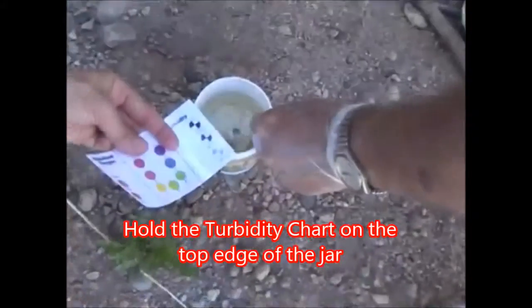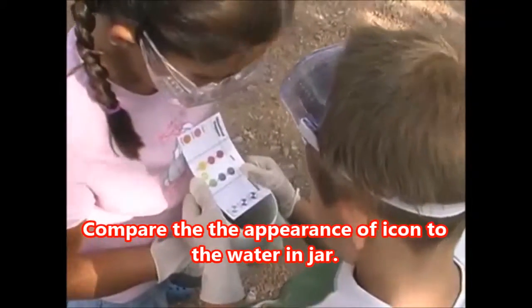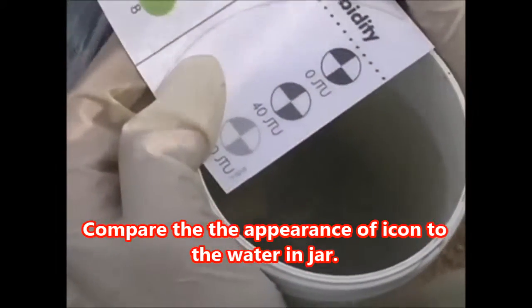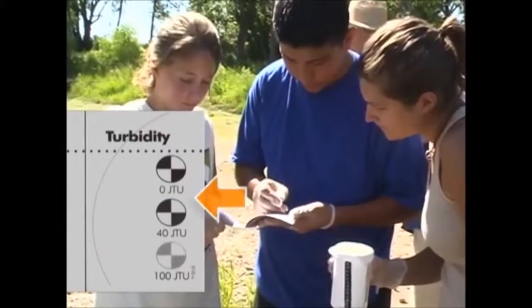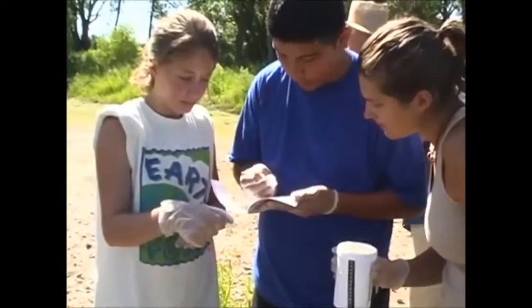Hold the turbidity scale on your card partially over the top of the jar. Now compare the 3 turbidity measurements on the chart to the appearance of the disc inside the jar while looking through the water, and determine which one most closely matches it. Record the turbidity value 0, 40, or 100 JTUs, or Jackson turbidity units.